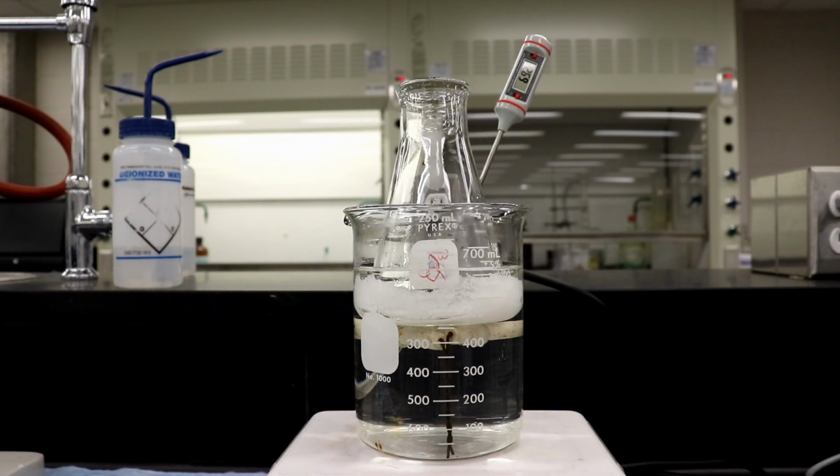Alright, so we'll resume. Oh god. Alright, well, I just broke the timer. So we'll just kind of roughly count it based off of the video. But we're basically looking for it to what? To melt, then crystals to form? Yes. Okay. The mixture should liquefy and then crystals will form.